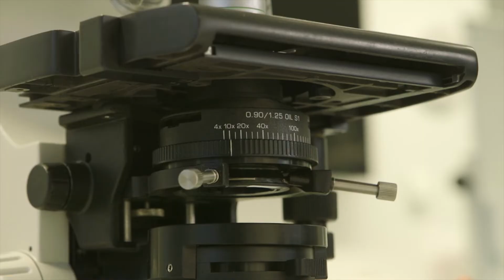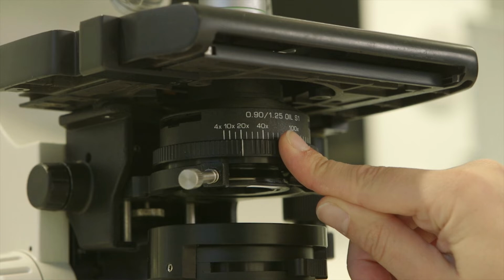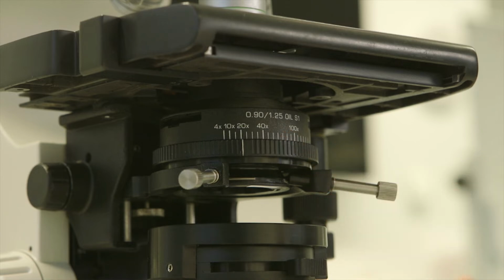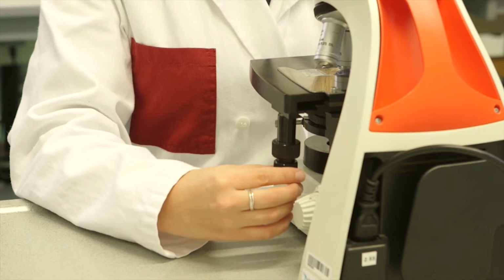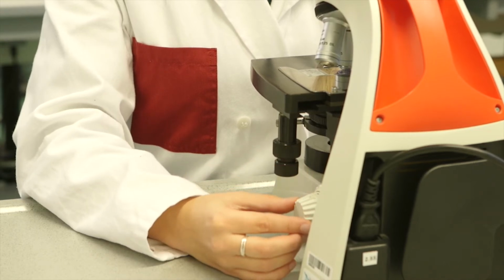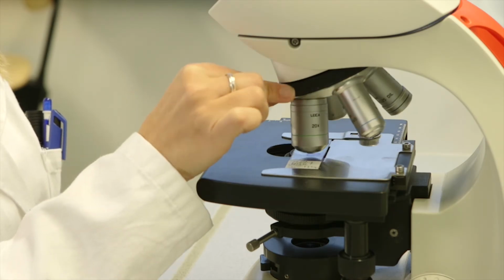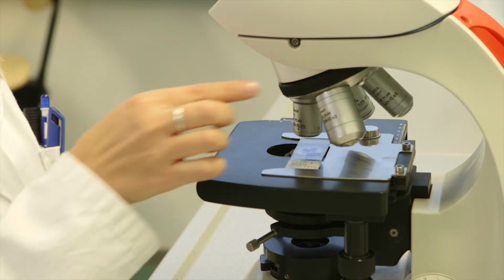Because the magnification has changed, we also need to adjust the amount of light coming through the section. This is done by turning the aperture diaphragm setting to 20 times. Also, the image must be focused by turning the coarse and fine focus knob. If the focus was already well adjusted with the 10 times objective, there should only be minimal adjustment needed with the focus knob. If the image cannot be focused with only a small adjustment, go back to the 10 times objective and adjust first at this magnification.